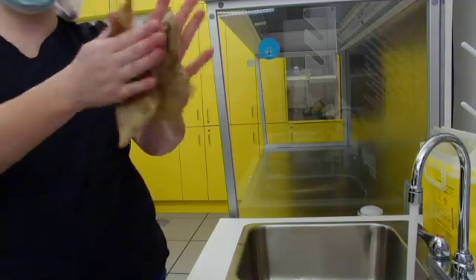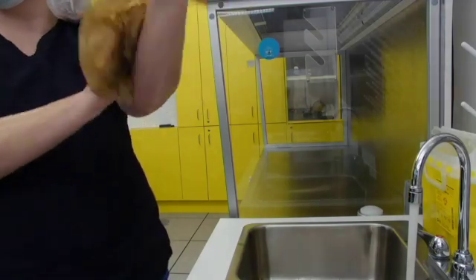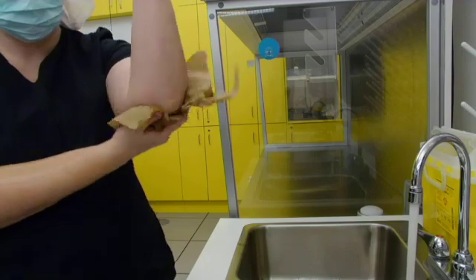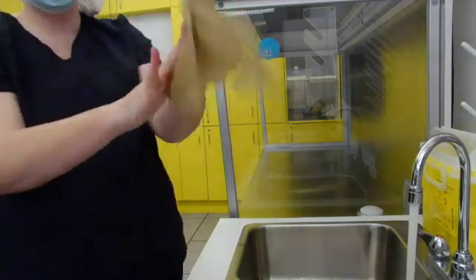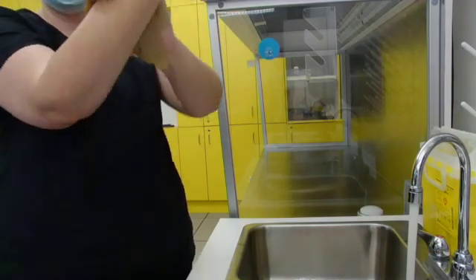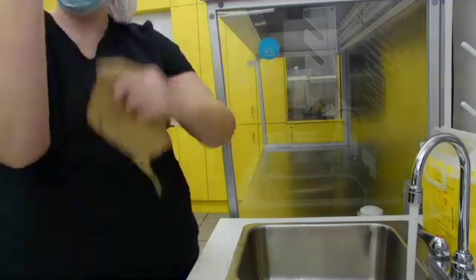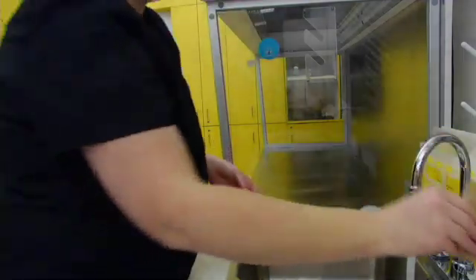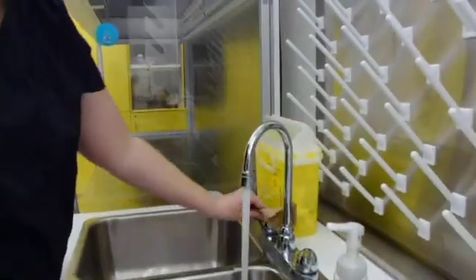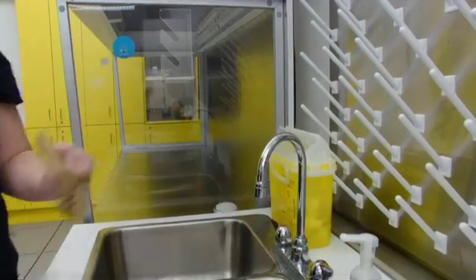Starting at your fingertips of one hand, pat dry — don't rub, as this can be abrasive to our skin, especially when we wash them so often. Pat dry all the way down from your fingertips to your elbows unidirectionally, not going back up again. Think about those rainbow bands. If you don't have a hands-free sink, you may use a clean paper towel to turn off your sink, making sure not to touch the faucet with your clean hands.